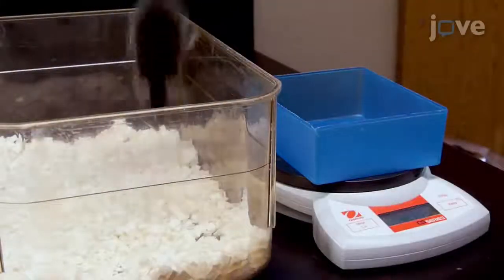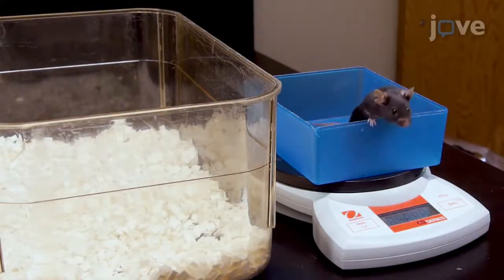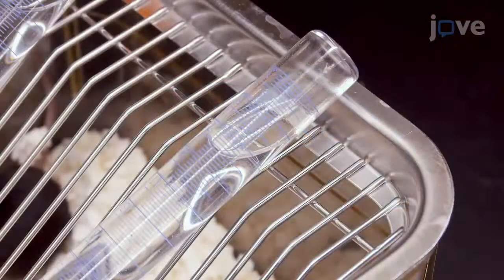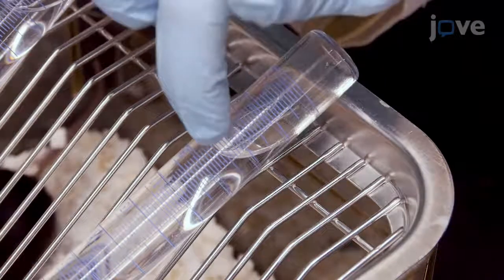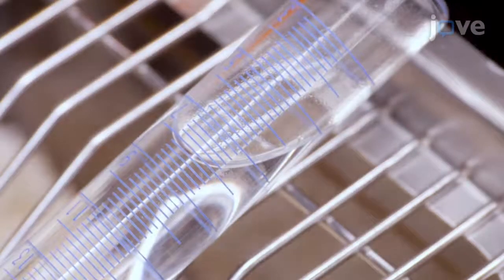Beginning on day 4 of the 1-week single housing acclimation, measure and record the mouse daily body and food weights. Measure the water intake using the etchings alongside the inverted bottle to record the highest point of the meniscus. Once water intake has stabilized to plus or minus 10% variability from the mean of the last 3 days, begin ethanol access with either TBC or DID.